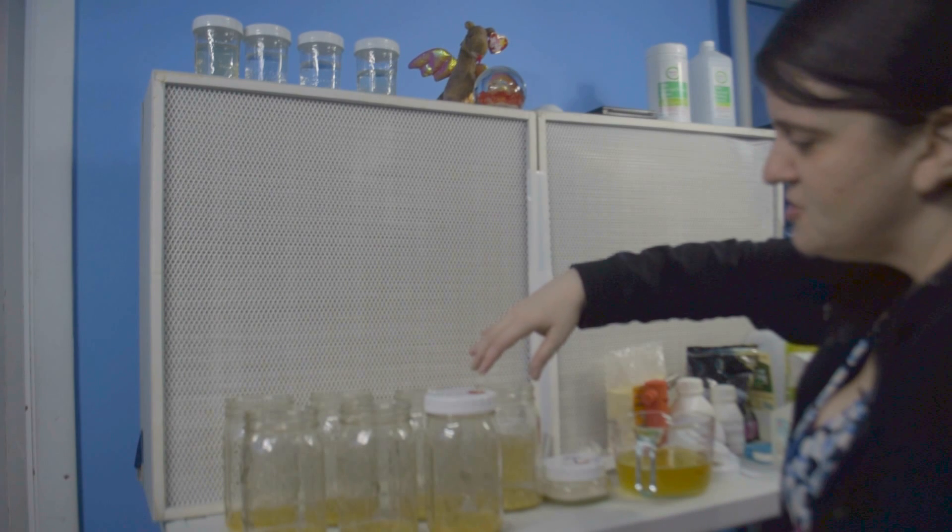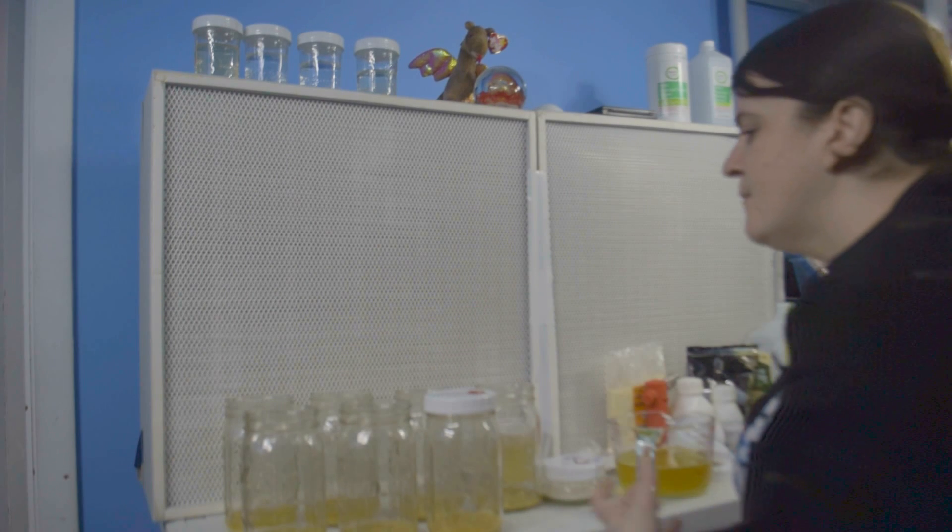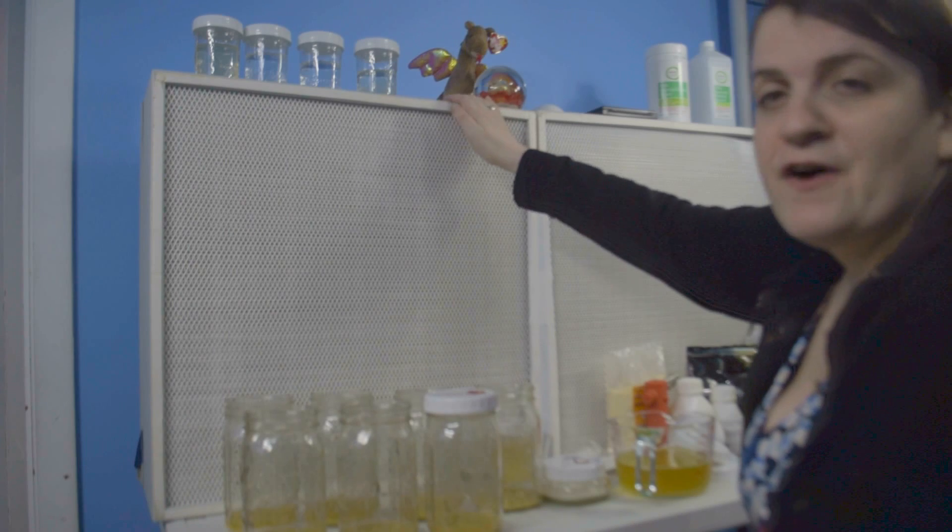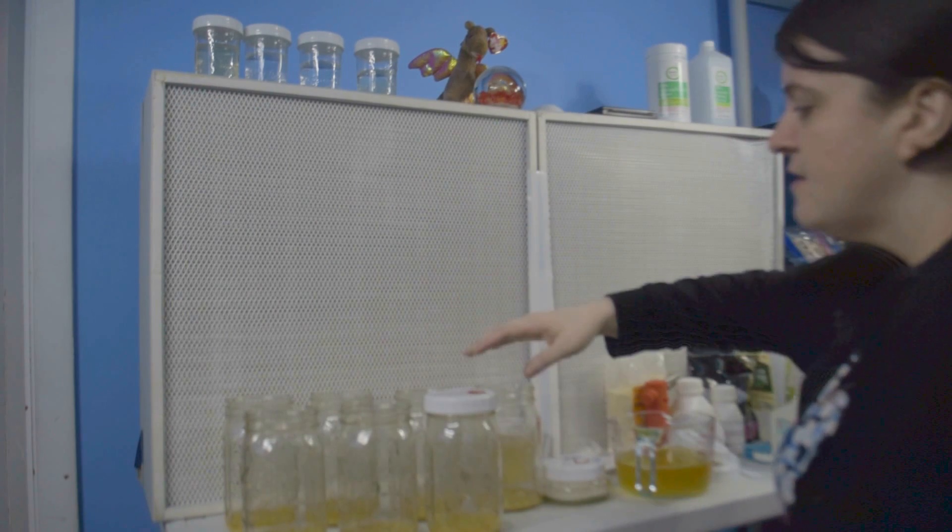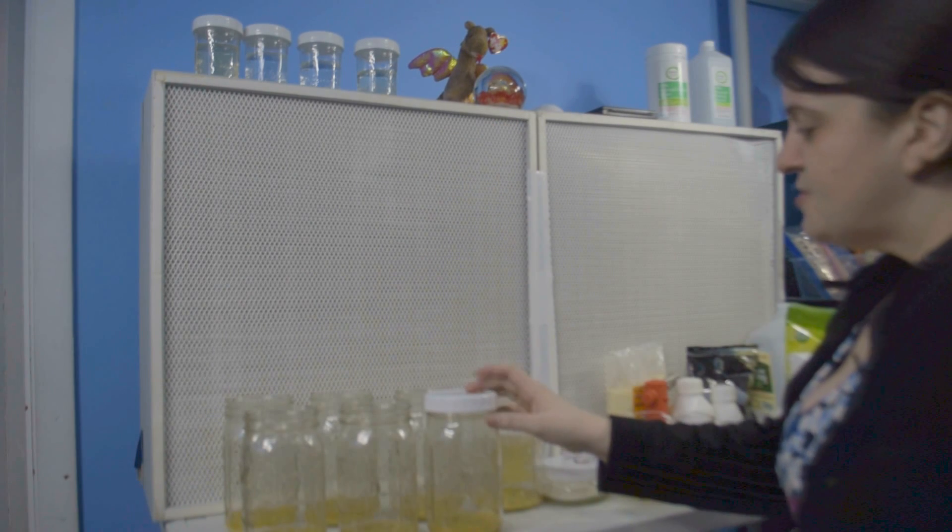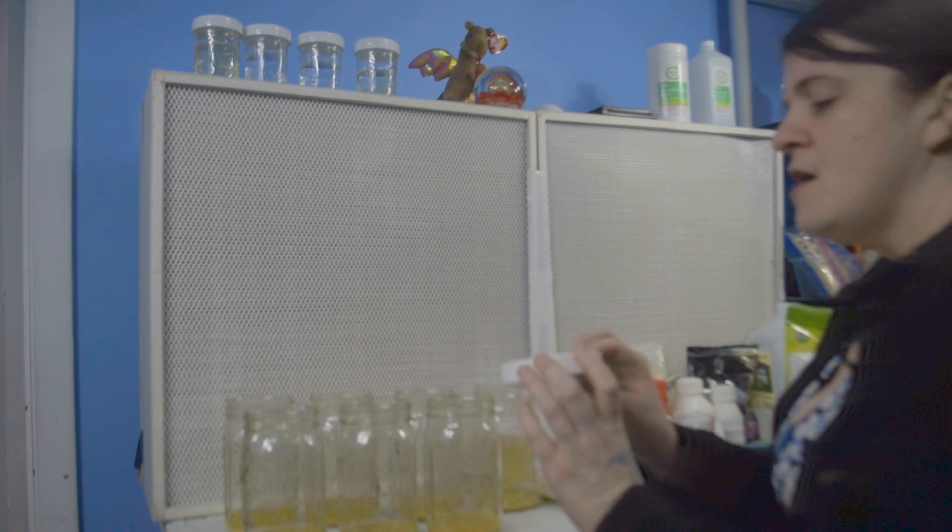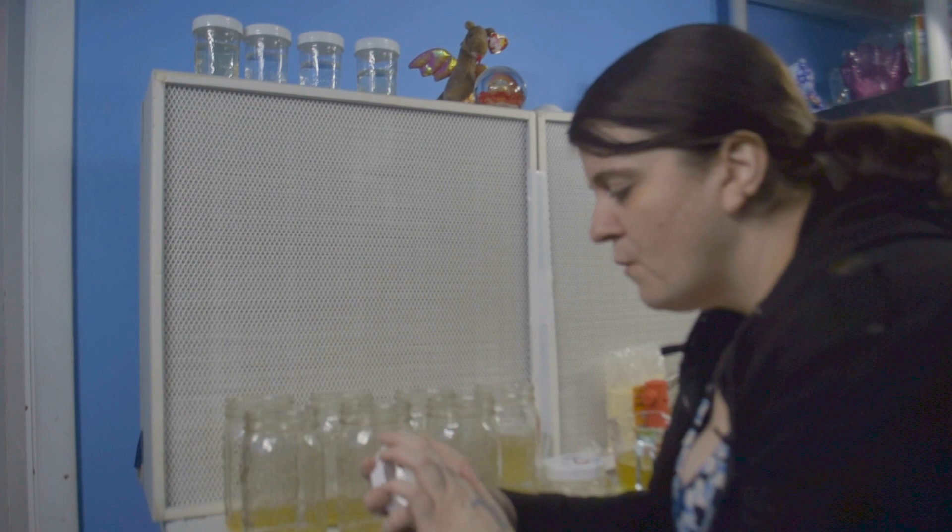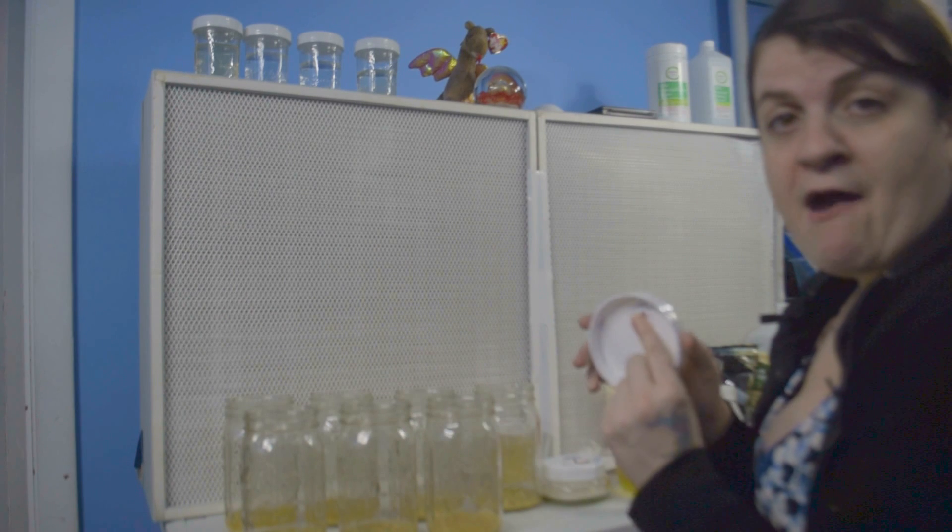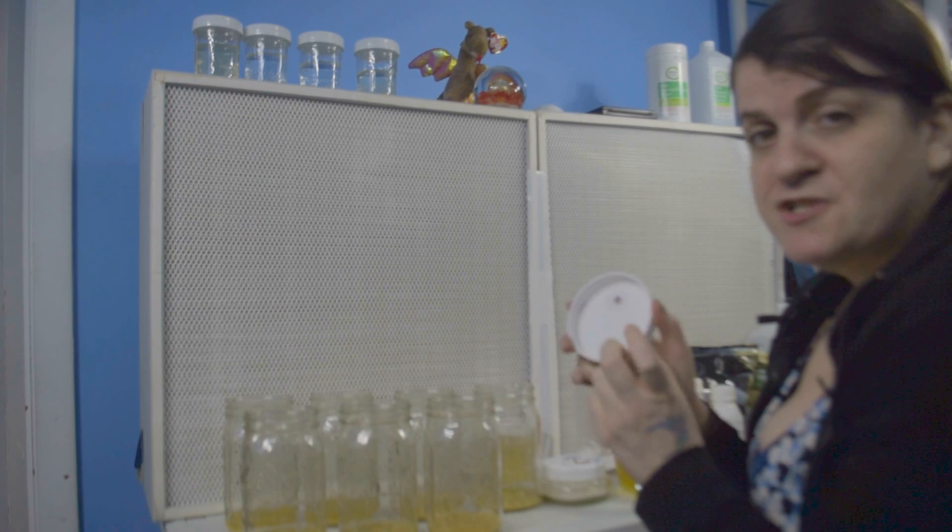But to me, I just, I believe that I'm working in this environment for a reason. I need my lids to be sterile.